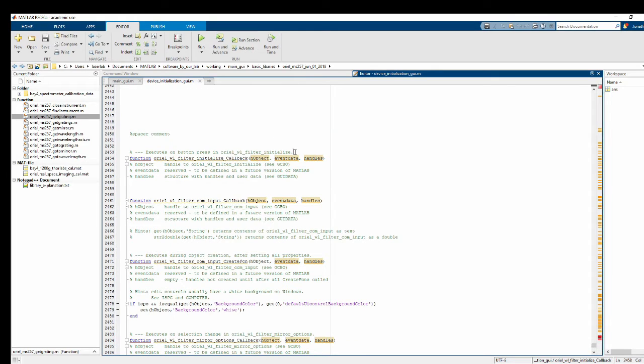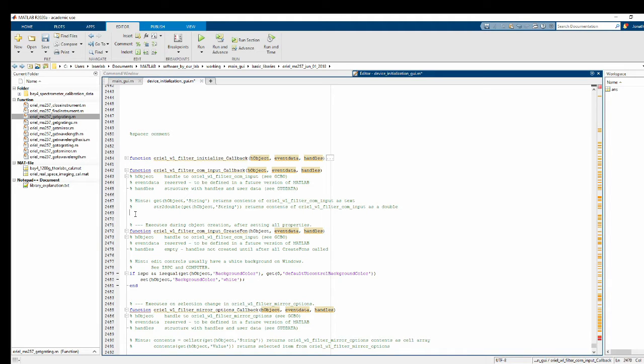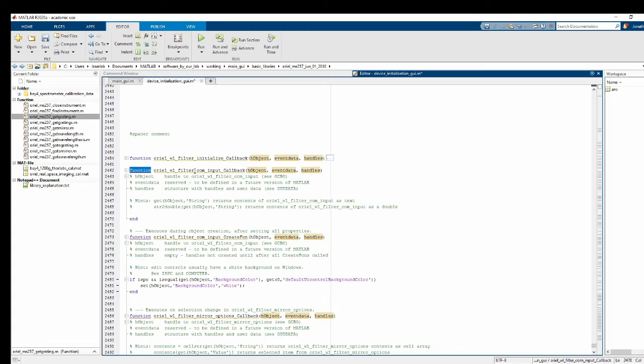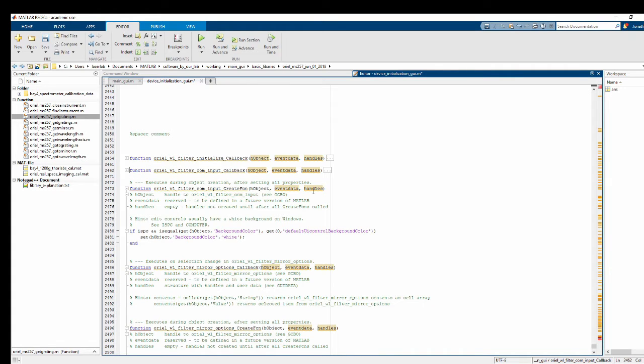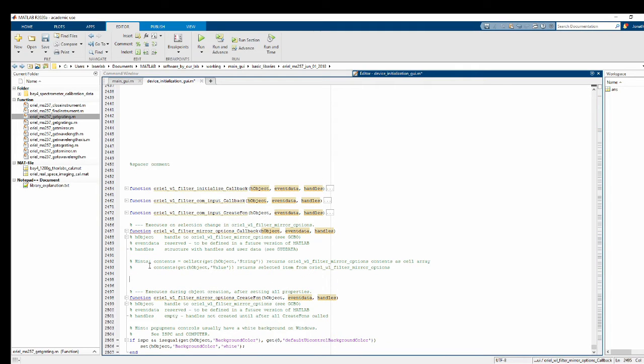Now, this is a personal preference for convention. I don't like these extra comments that they add to be outside the code. I like to put more broad comments outside of the code, talking about the structure of it, less generic. These comments, I mean, "executes during object creation," that's not really insightful, so I just throw that inside at the top so I don't have to look at it. I also prefer to put an end statement on each individual function. I just find that that feels a lot more organized to me.